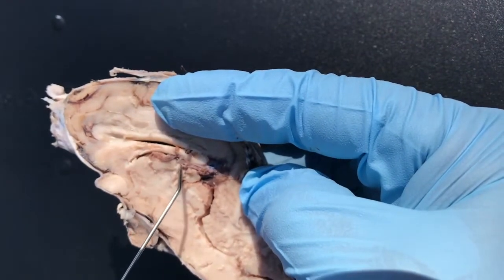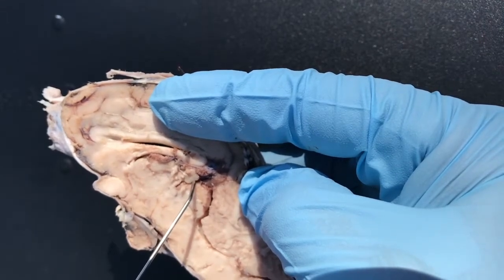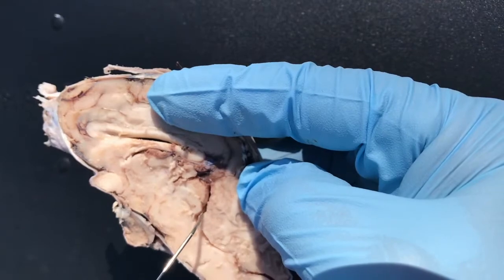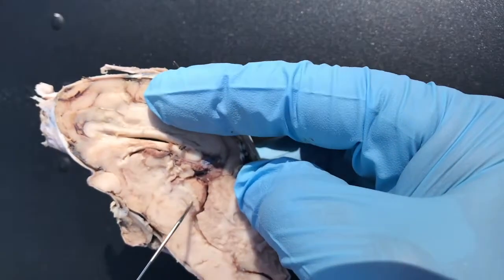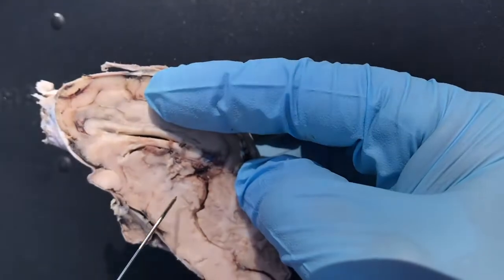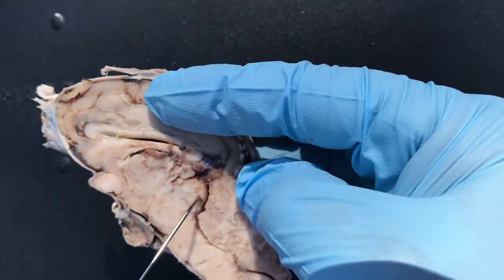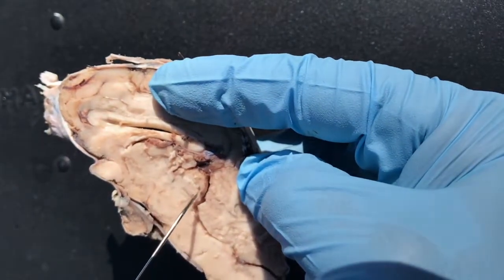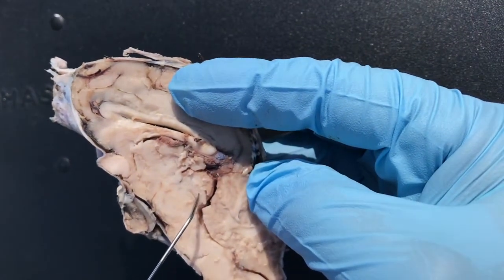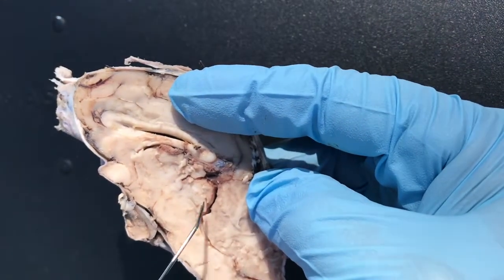Now on the other side of the thalamus, you have this little gland right here — here's your pineal. This is the pineal gland. And then again, here's your tectum. And these two, plus the other two on the other side, is called your corpora quadrigemina. The top here is your superior colliculus and inferior colliculus. You have two on the other side, and that makes up your corpora quadrigemina.